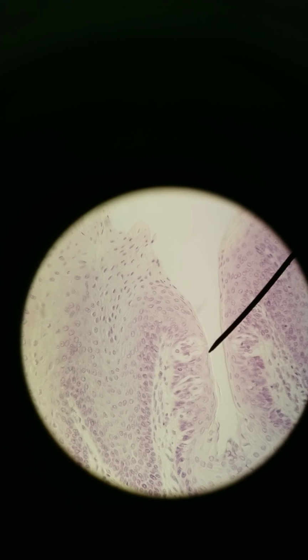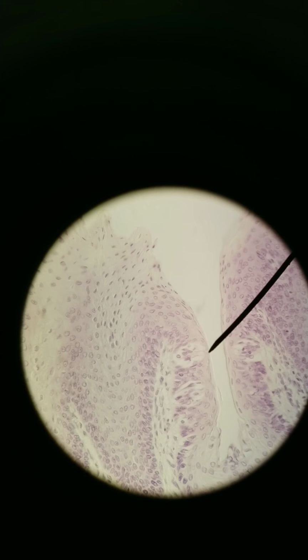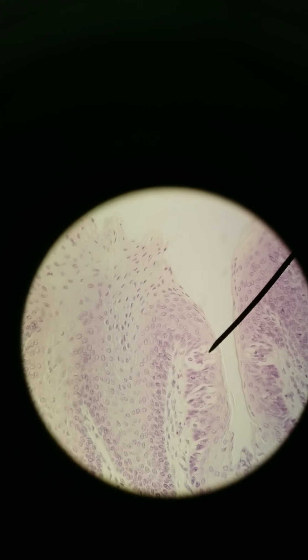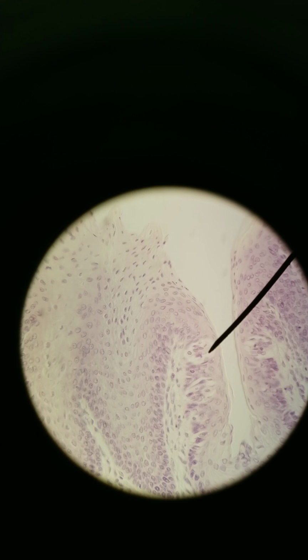So when you taste something, you've got food mixed in your saliva, and that saliva mixed in with food can wash over these pores. And then these cells, these gustatory taste cells, can be activated by different things, whether it's something sweet, salty, umami, bitter, or what am I missing? Sweet, salty, umami, bitter, acid, sour. There we go. 5 major tastes. We can taste that with those special gustatory taste cells. These taste cells, this cluster, that's what a taste bud is. This cluster of cells is a taste bud.